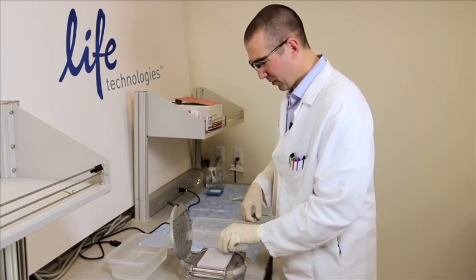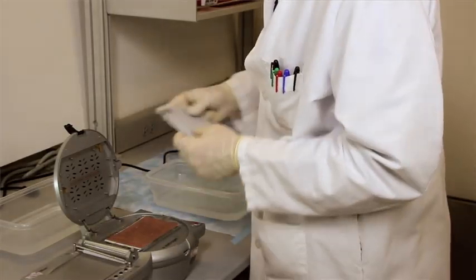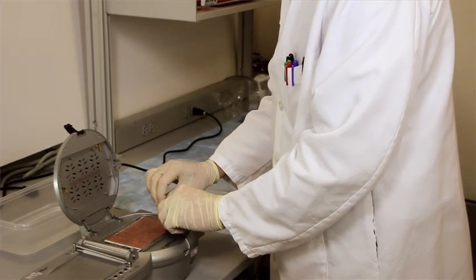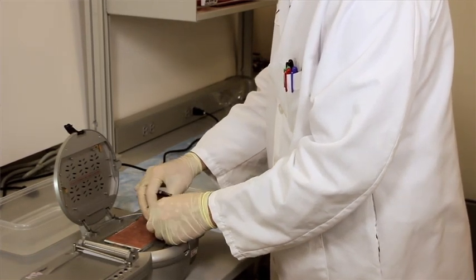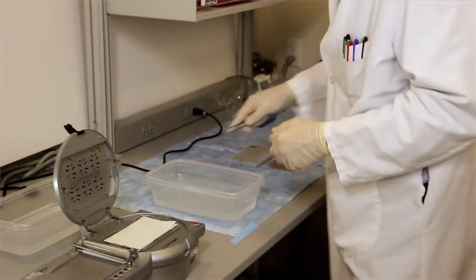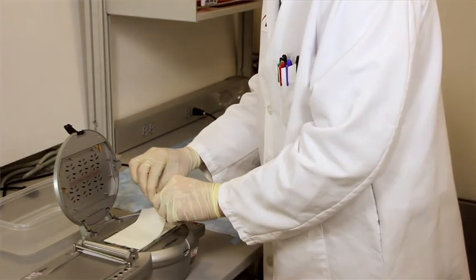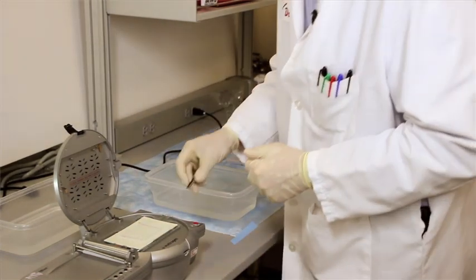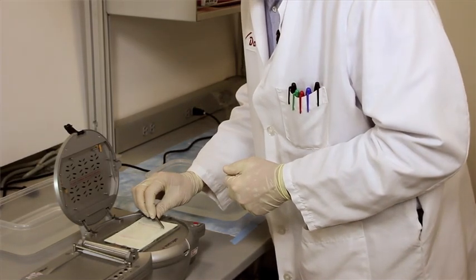So first of all, open the apparatus, take off the sponge, take off the top electrode, take off the filter paper, take off our NuPAGE gel.